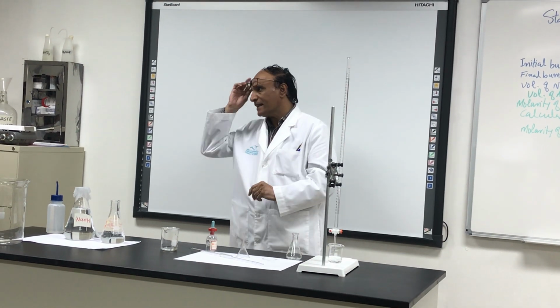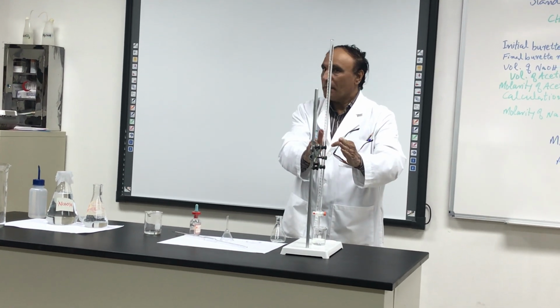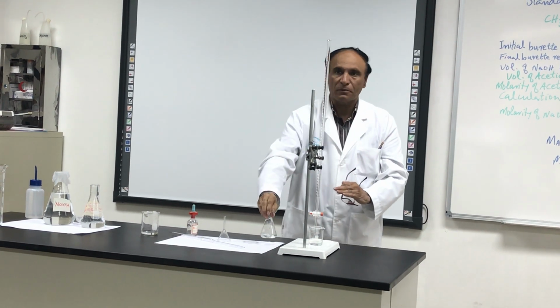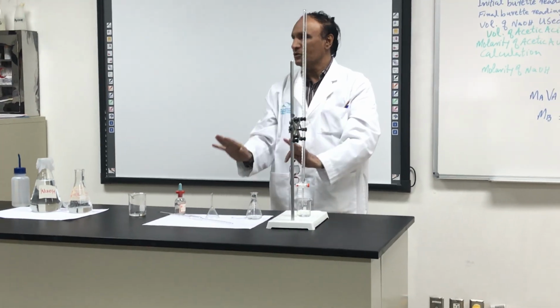It will be done by the second student. The 2 students are doing together. One student is doing his job. By the time he will finish his job, the other student will finish his job. Did you understand what I am saying? Yes. So both the things are ready to use.